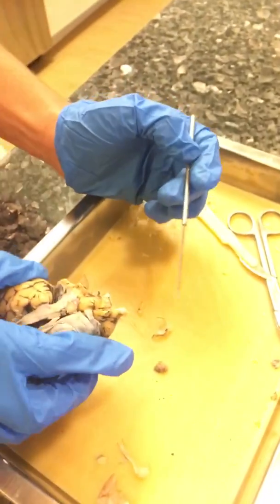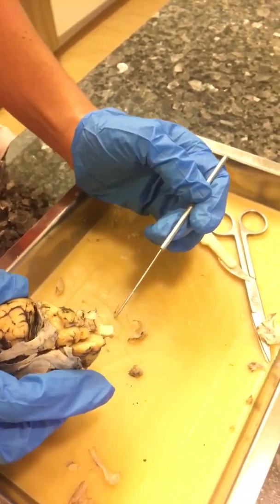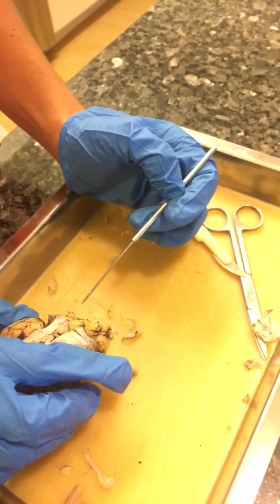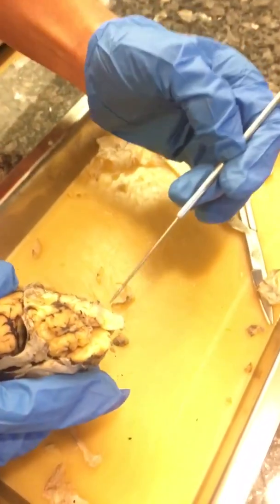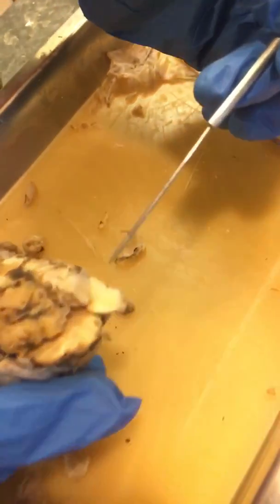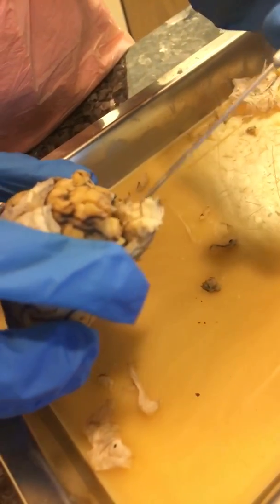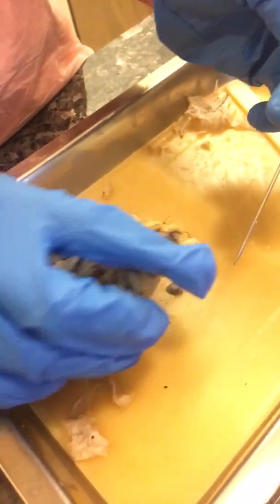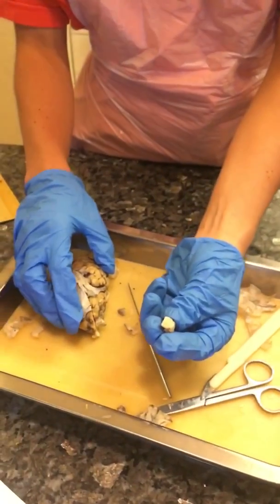The ventral root and the dorsal root are part of the spinal cord, but on my sheep brain they really aren't visible. They're on opposite sides and they connect to the spinal cord — I wish I could show them, but they don't appear to be visible. And here is my small cross-section of the spinal cord.